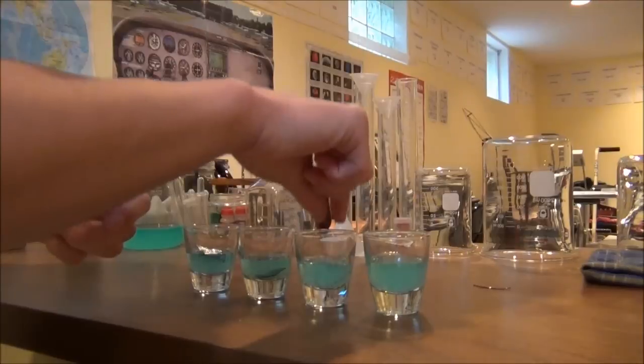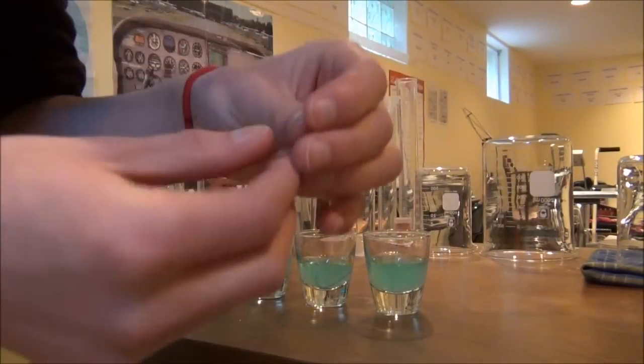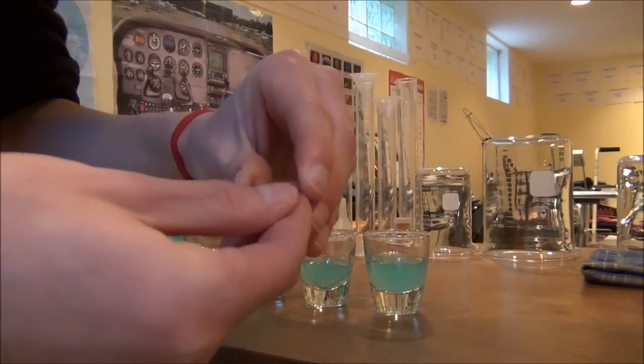All right and that goes in glass number three. And finally in the last glass I'm just going to put a piece of copper wire and we're going to see what that does.